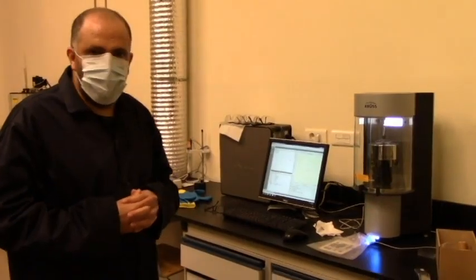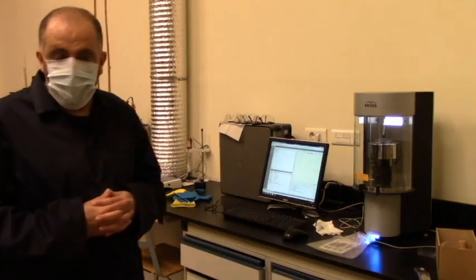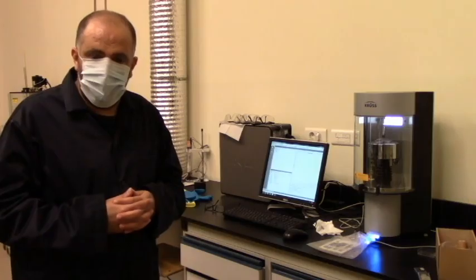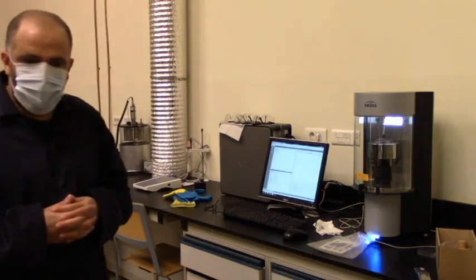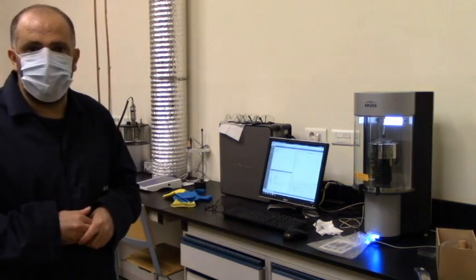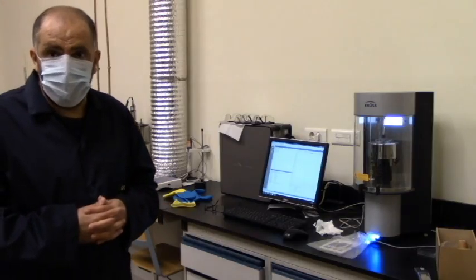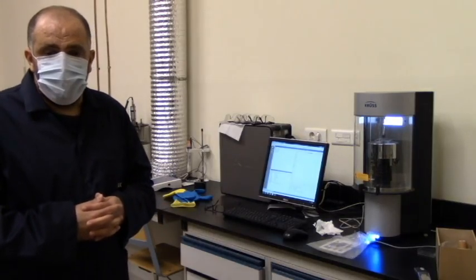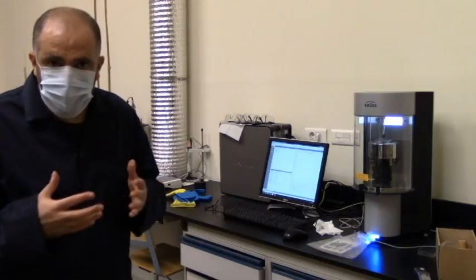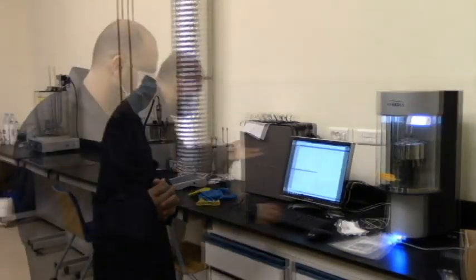So now we will have two values that are changing with one another: the force, which is always the case, and the position of the sample, which will be given as well. Each value corresponds to one position. We will use this, as given in your manual, to plot force against position, and from there we'll be able to calculate the force at zero position, and from there the wetted length, as we'll see in a minute. Here the run is over.